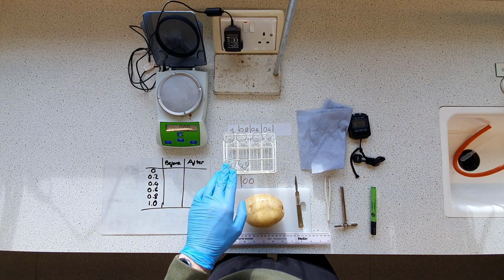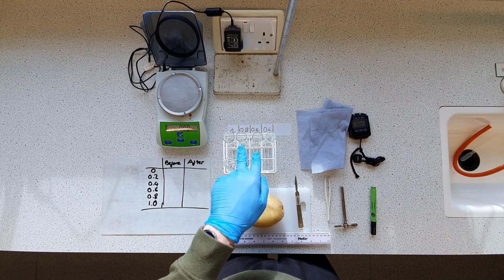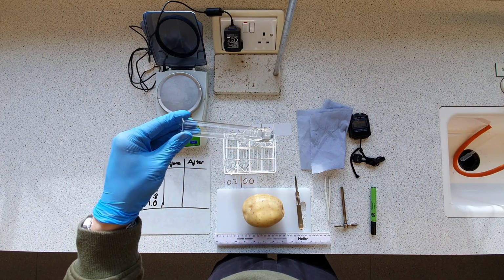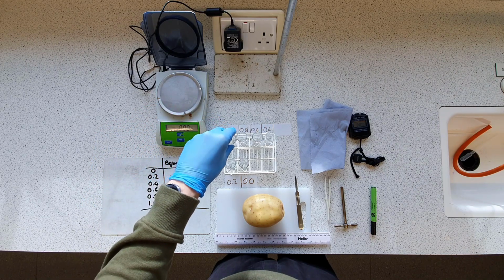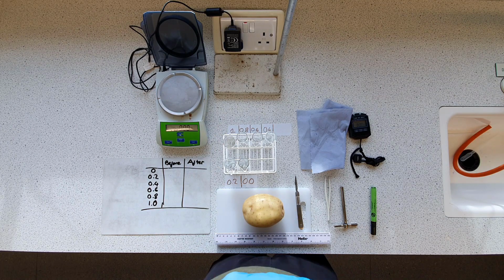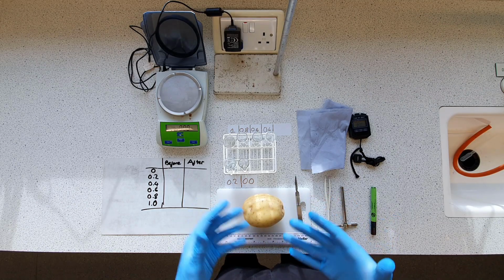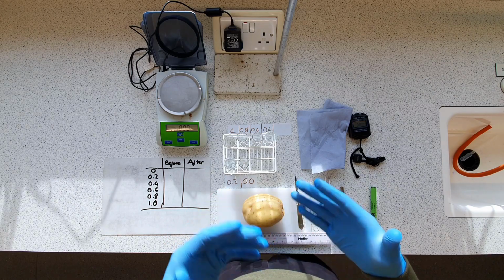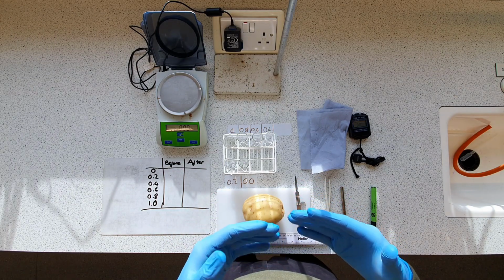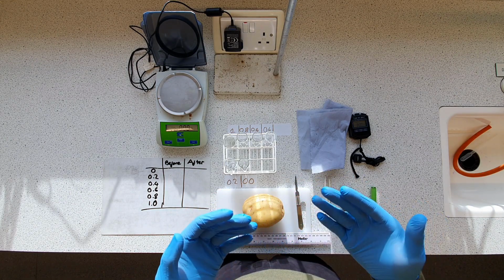And then as we go up here, we've got a bit more sugar, bit more, until this one, and let me tell you, just from personal experience, this is very hard to actually dissolve at this concentration because it's almost entirely saturated. Anyway, so we've got our 6 different concentrations here, and we've got our potato. So how are we going to measure how much water transfer goes on, how much osmosis occurs?